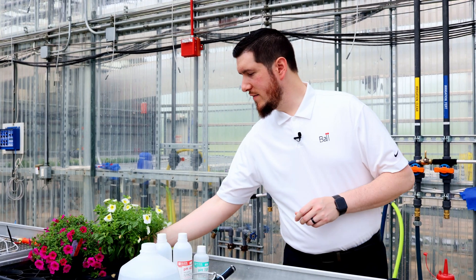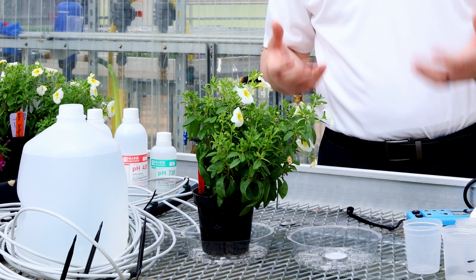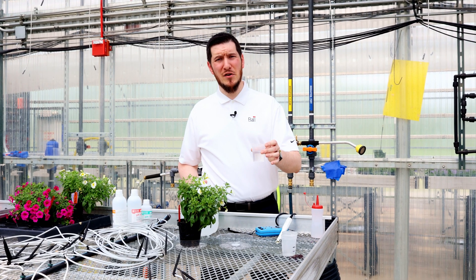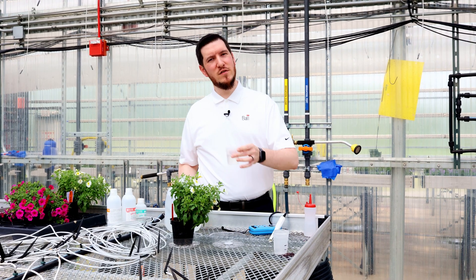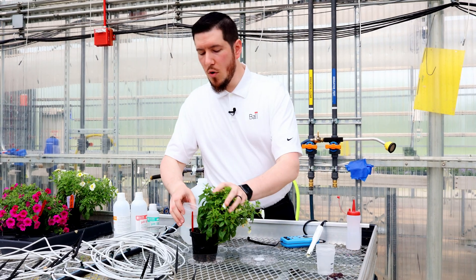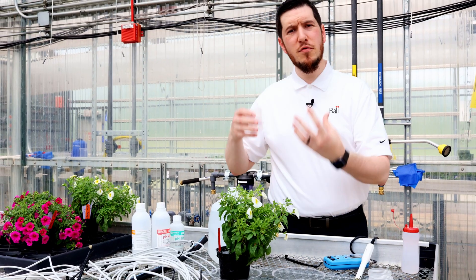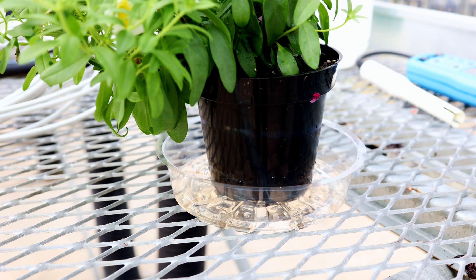After all excess water or fertilizer solution has had a chance to drain off, take one of your plants and put it onto a little saucer like this. Make sure the saucer is clean and dry before doing so. Then add about 75 milliliters or a third of a cup of distilled water — make sure there's nothing else in your water — to the top of the growing media. When applying water, make sure it fills the head space so water can move through the soil profile as a front rather than just channeling through one part of the growing media.